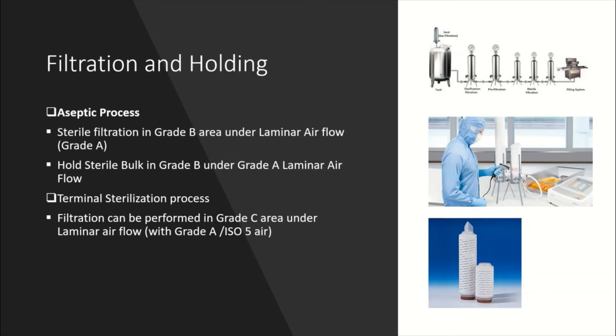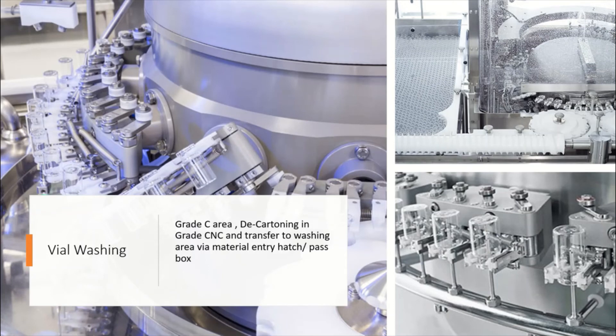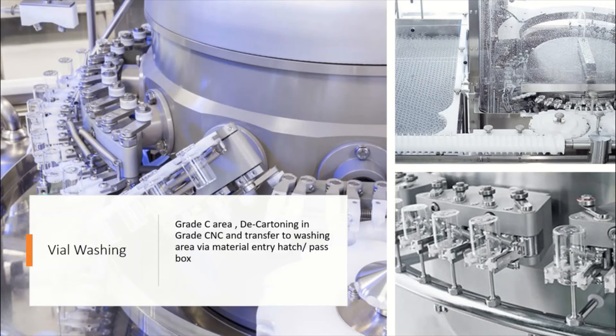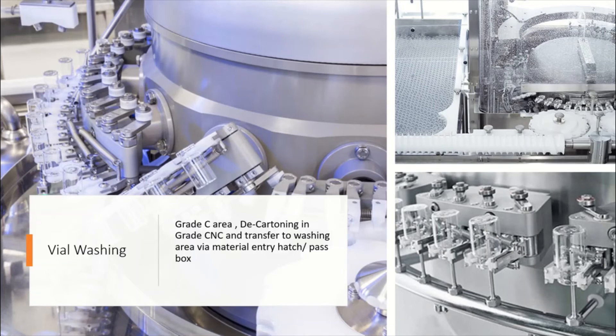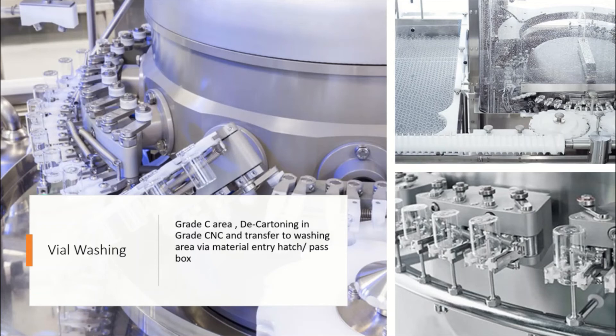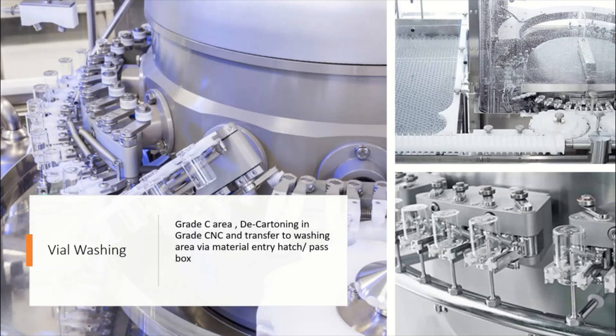The next stage is vial washing. The vial washing machine is to be installed in the Grade C area. To remove the carton and to inspect vials for any breakage or segregation, this can be done in the CNC area. Material then needs to be moved to the vial washing zone through a material airlock or pass box. Appropriate gowning practices as per Grade C need to be used by the operator.